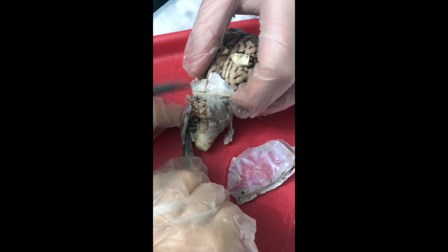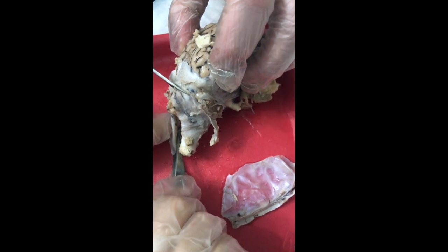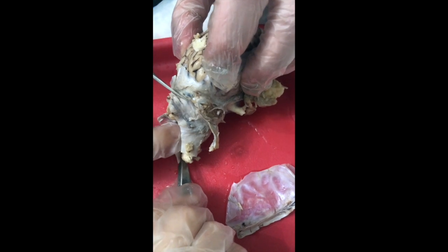Can you do the same thing on this? You want this cut further? Yeah, well, it's gonna come off. It's gotta come off. So we're gonna go this side. Yeah. Sit this side of this, right? Yeah.